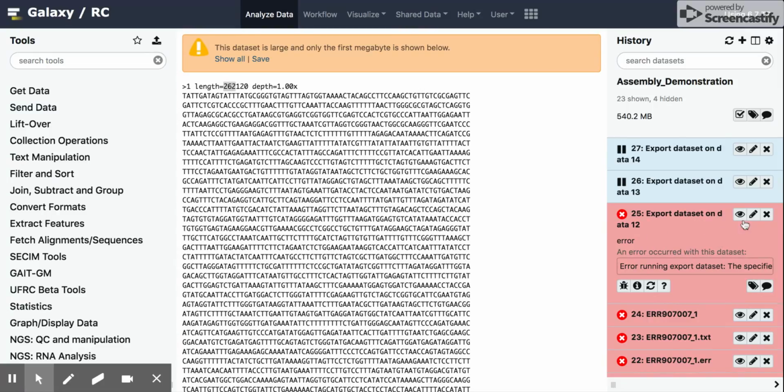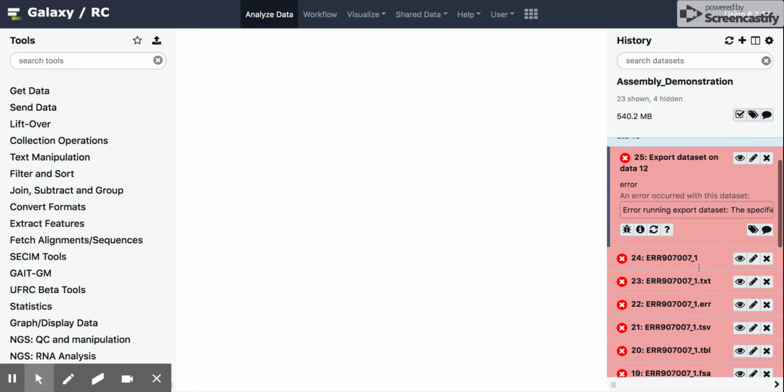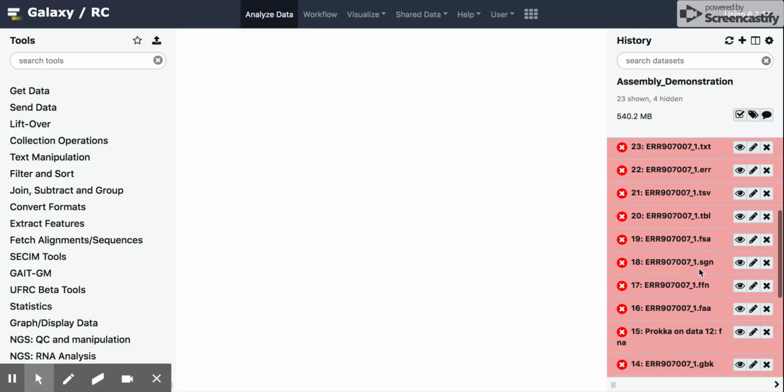but basically that's one of the steps that failed right here. If we look at it, we can see that it wasn't able to write to the place that I was interested in submitting it to. That can be changed and rerun, which we won't go into detail. The main thing I wanted to talk about is the Prokka step failing.